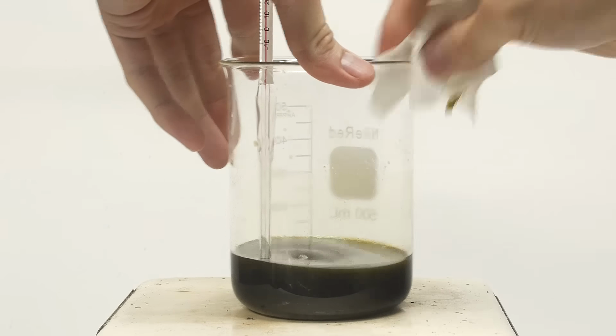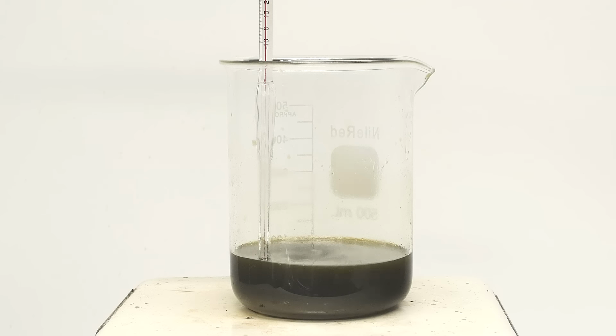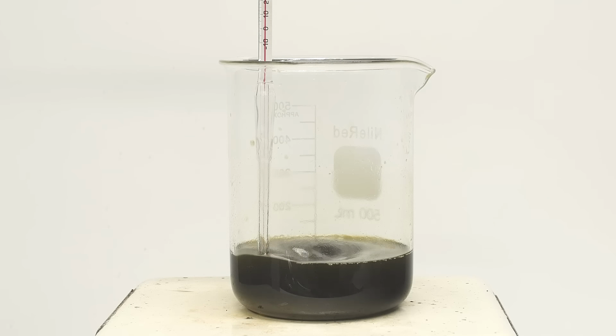The amount of glycerol that I calculate is going to be slightly lower than it should be, but this isn't really a problem. For this reaction, I actually want to use less glycerol than is needed to make sure that the fatty acids stay in excess. This way, we can really promote the formation of triglycerides over things like diglycerides or monoglycerides. So, on top of the already low glycerol estimate, I knocked off another 10%.